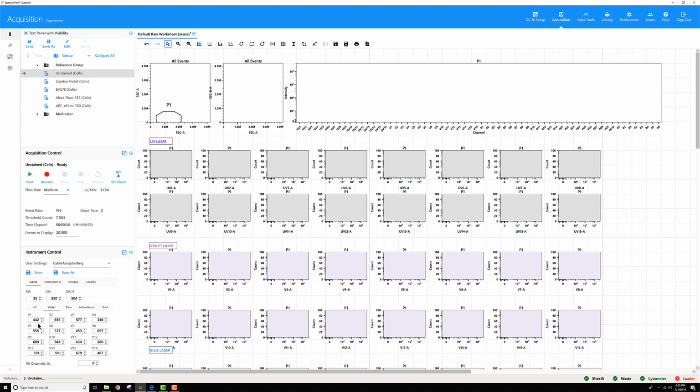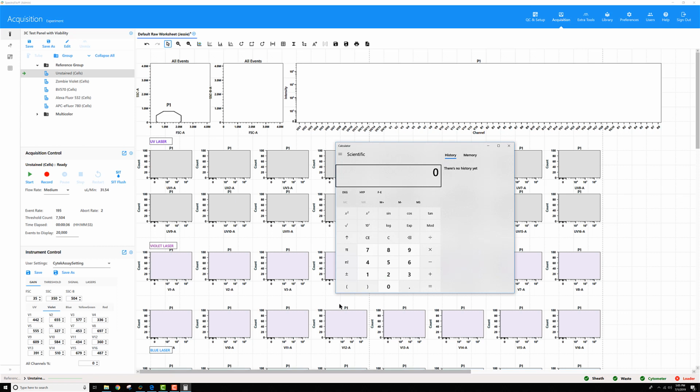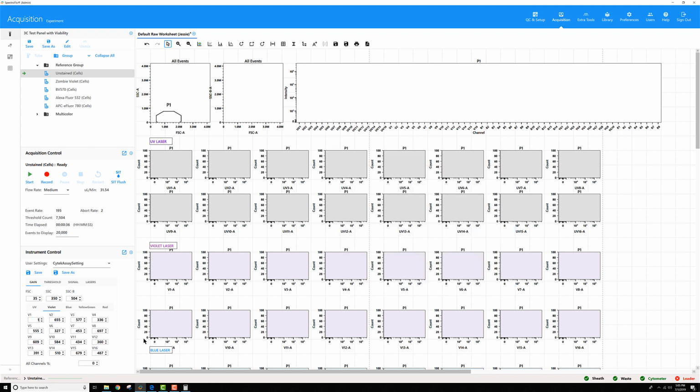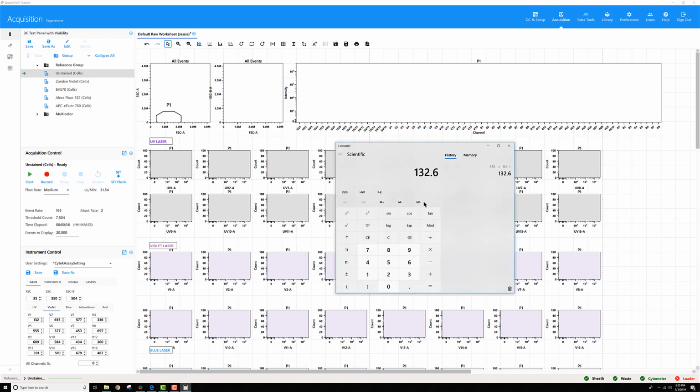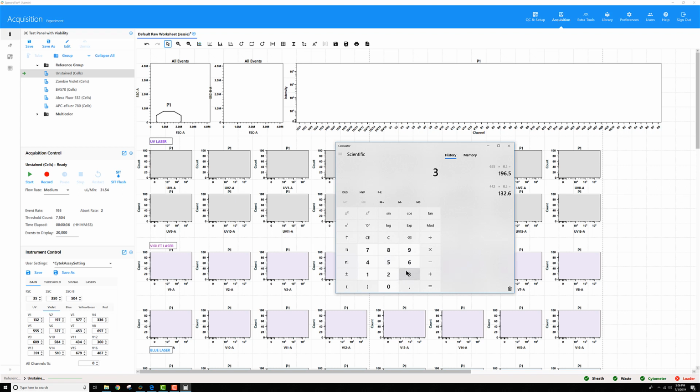Okay. Now, I know I had to take it down about 60 to 70% to get V1 through V5 on scale. So let's go ahead and open up the calculator. So for the first one, 442, let's say I want to take it down 70%, so I'll have 30% left. I want to set it around 130, 132. Let's do the same for V2. I'm at 655. Take it down 70%, means I've got 30% left. It's 197, give or take. All right, V3 is at, let's see, 577. What is 70% reduction there? It's 173.